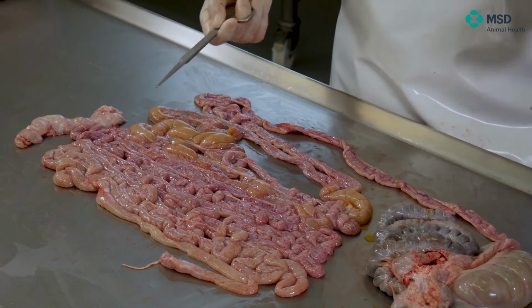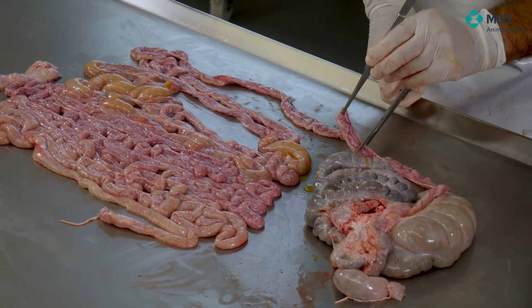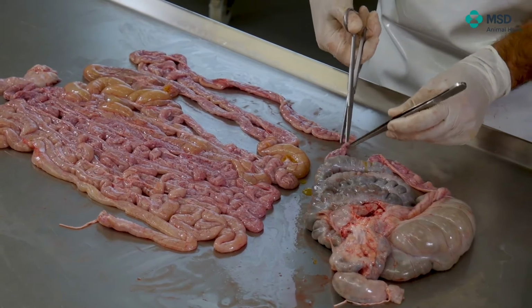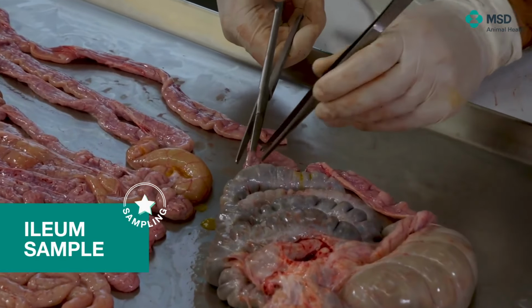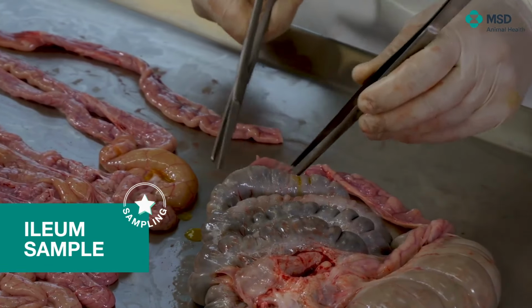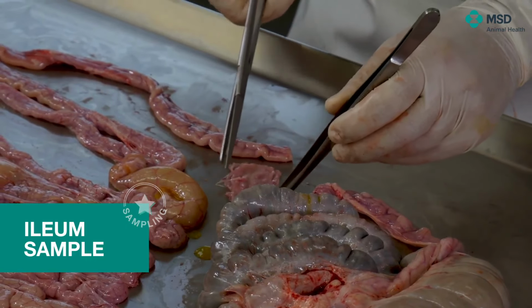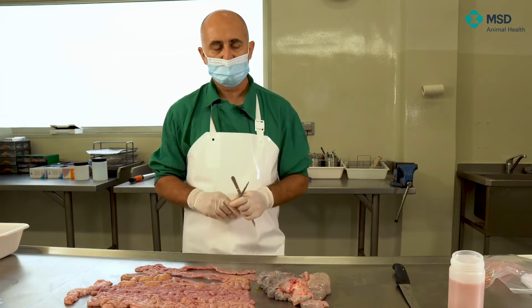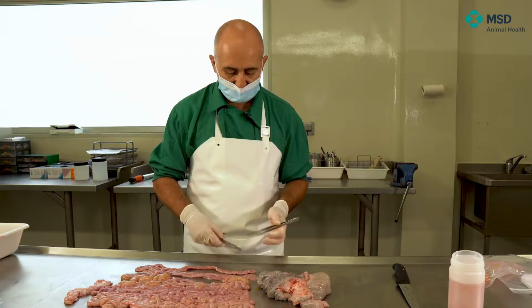Which type of samples do we take for histopathology? For example, if we are in the ileum, we can take one piece. I'm sure I'm within the ileum, no more than 4 or 5 centimeters, and very importantly, open longitudinally. Why do we want to open it? Basically, because what we need is to fix the mucosa, because the mucosa is the part that we have to analyze, the part in which we have to ascertain if there's any lesion or not.